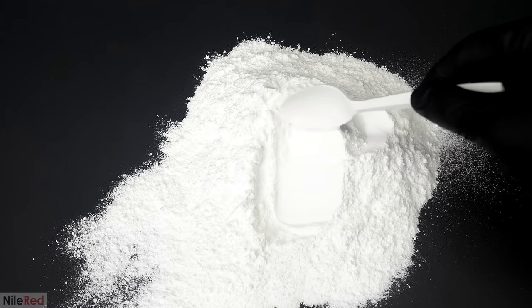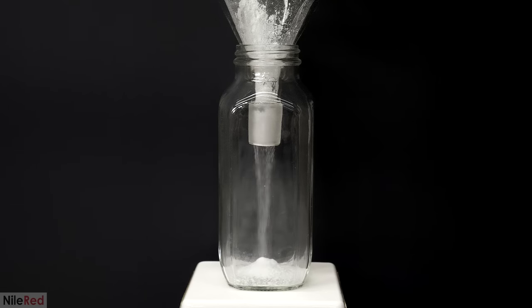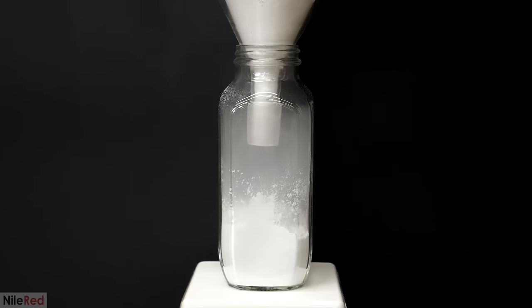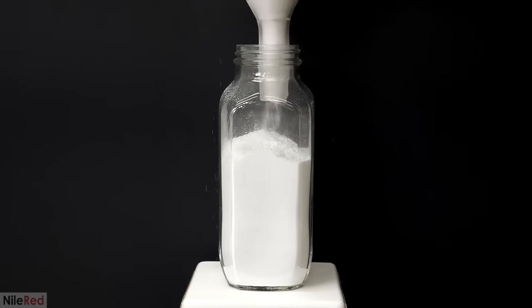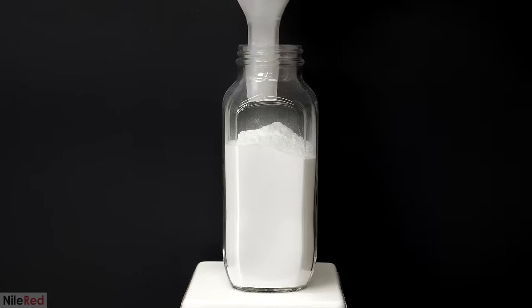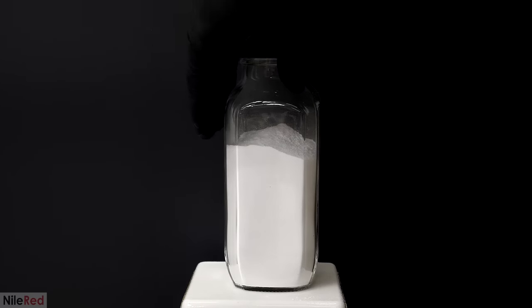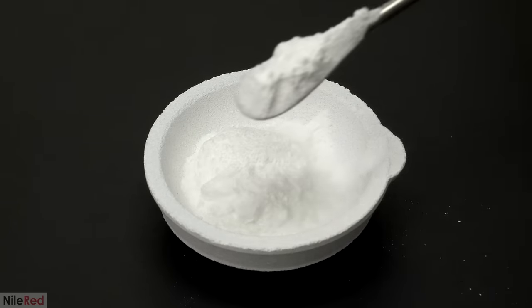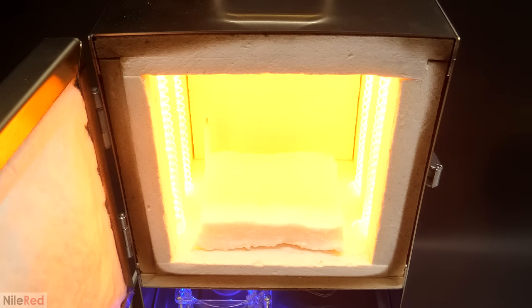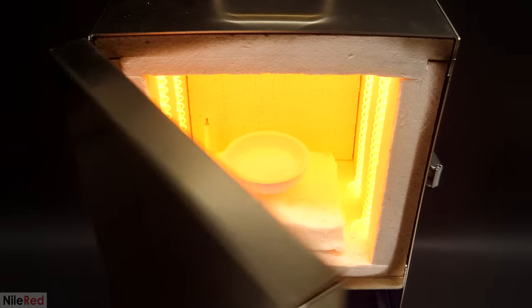This was definitely way better than before, and I hoped it would give me a better quality glass. Before adding any uranium though, it was a good idea to test it to make sure it worked — I had also never made glass before, so it was probably a good idea to get at least some experience making it before trying it with uranium in it. The general idea behind making glass was very simple and all I had to do was melt this powder. So I added a bunch of it to this dish, which was normally used to melt things like gold, and I put it into a small furnace.